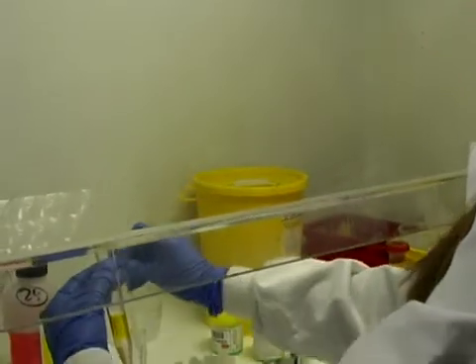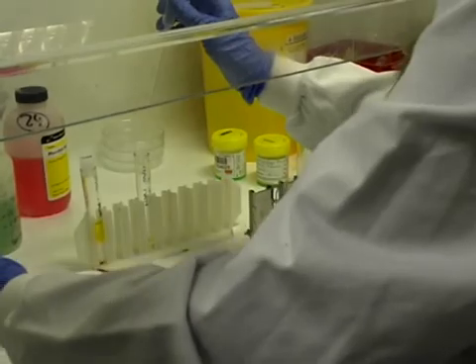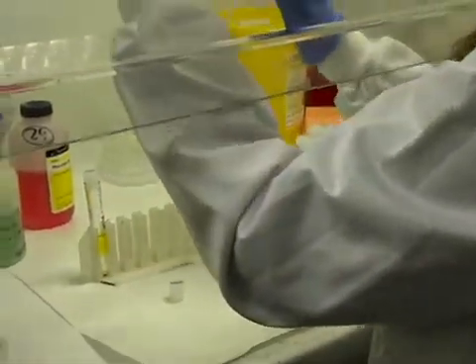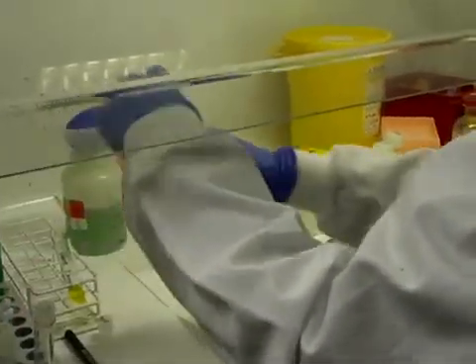We then put that buffy layer into a separate conical to which we then add another preservative.